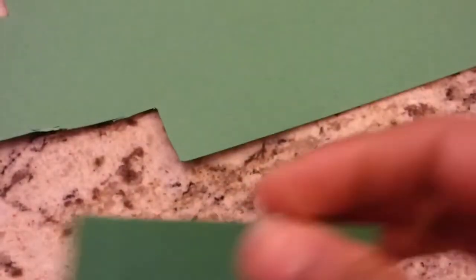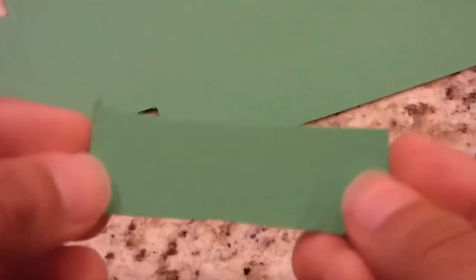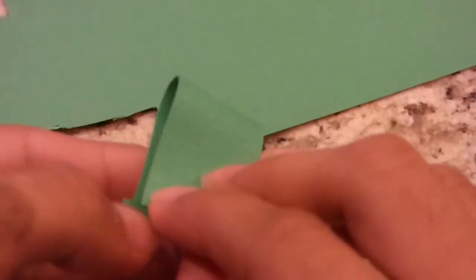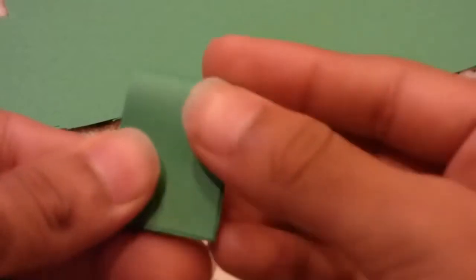Cut carefully using the shape you just made. Now that we have our rectangle cut out, fold it in half.